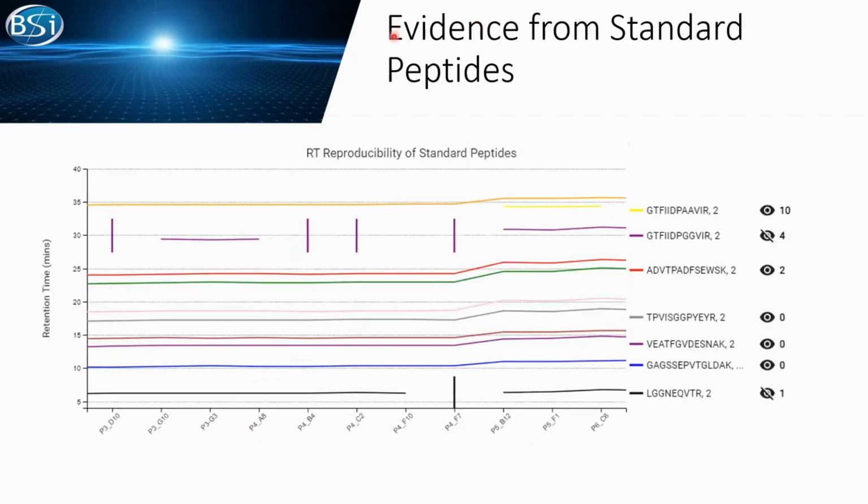Here is the evidence from the standard peptides. This is the retention time reproducibility of the standard peptides. On the bottom, that's our samples. And in here, all these numbers list how many times a standard peptide is not observed in certain samples. And if you click this I button, you can change the blank into this small bar. It tells you, okay, where your sample cannot observe certain standard peptides.